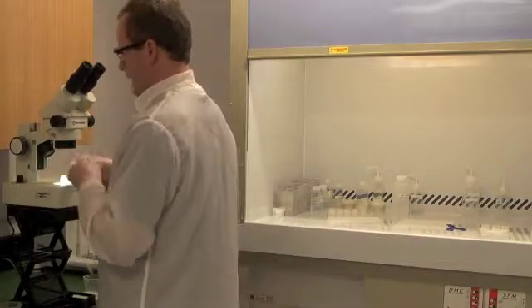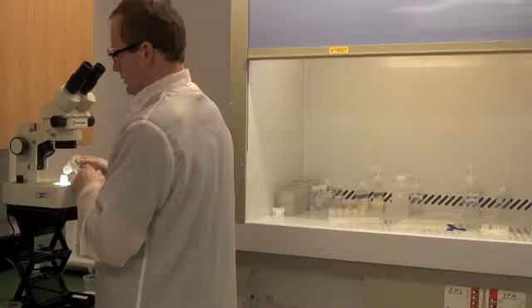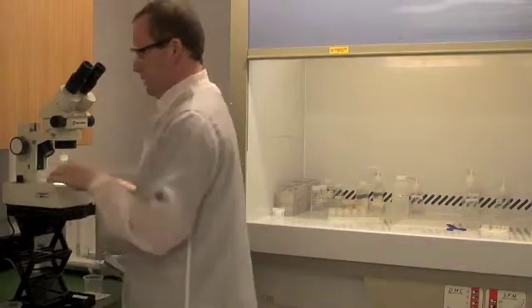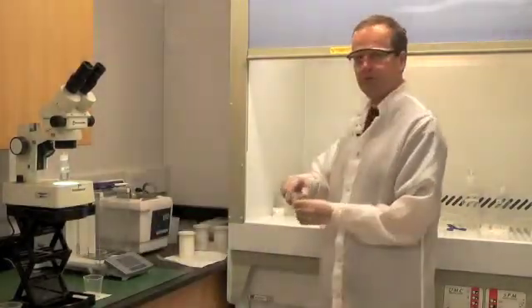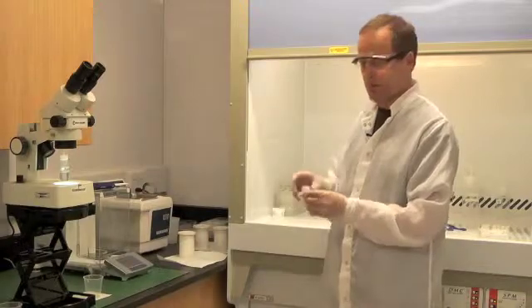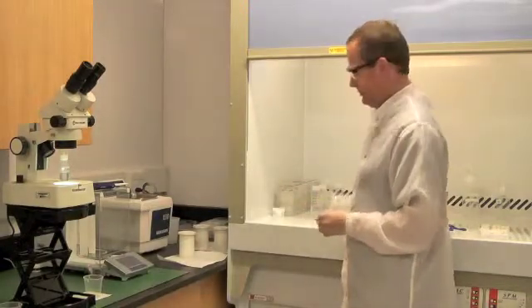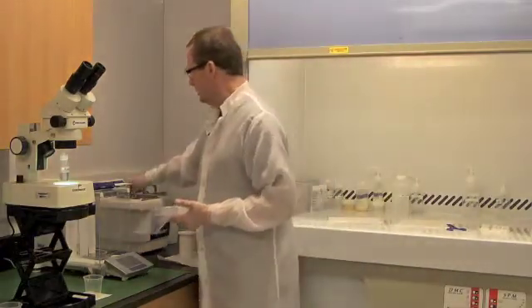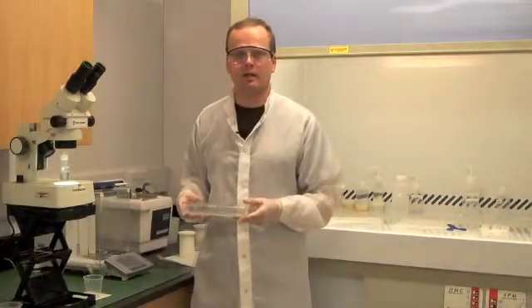And now I'm going to add about 12 drops of nitric acid, cap it, and along with the rest of the 15 zircons in their beakers, I'm going to place those into an ultrasonic bath. Turn that on for 30 minutes, and we're done.